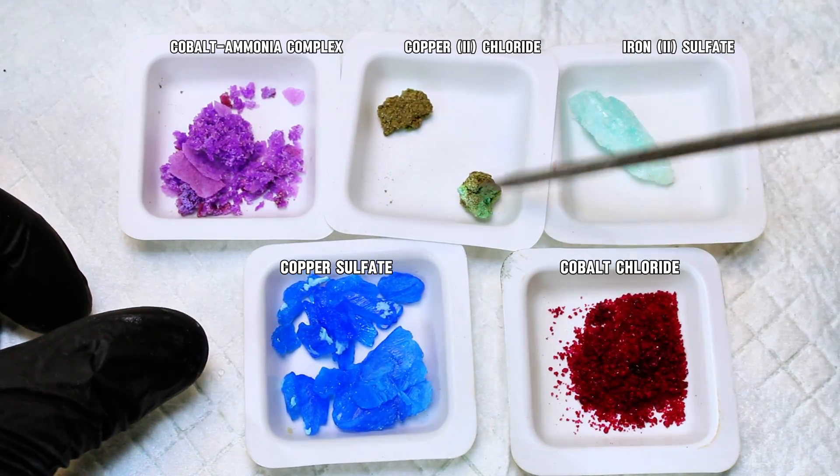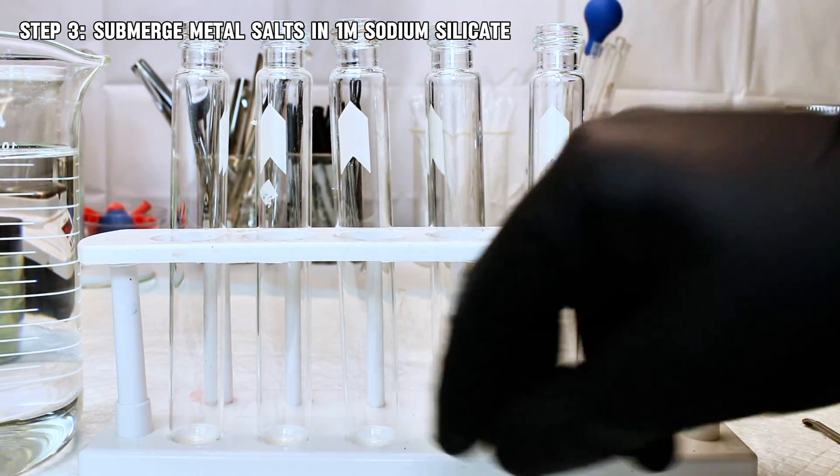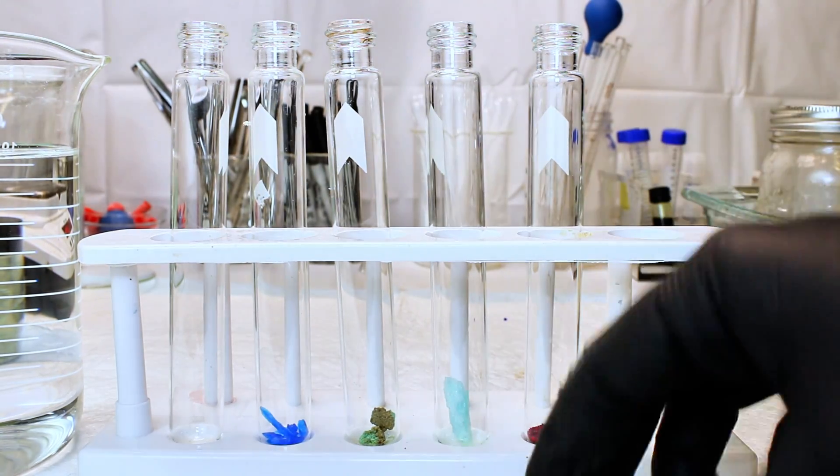I wanted to first try each of these salts at a test tube scale before committing to using any of them in mass, as different salts will form very different looking growths. A big and fairly obvious part of this difference is color.